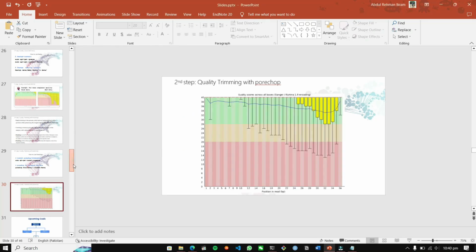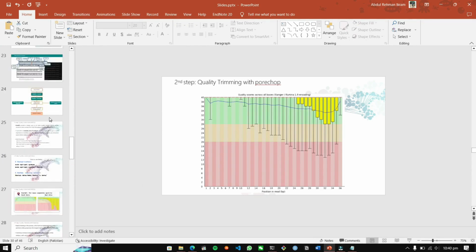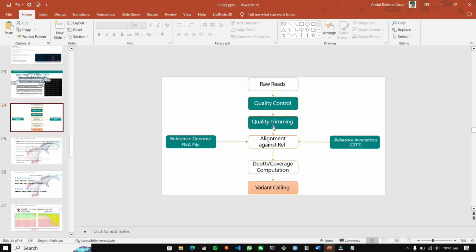So that was it for the quality trimming process. We know how to check our quality, and after checking the quality, how to trim it. Now if you are working on your main NGS data, first you have to check the quality of the data. If the quality isn't good, then apply the trimming process on it. After applying the trimming process, check the quality again. If the quality of the data has been improved, then your quality checking and quality trimming process was successful. So that was it for this lecture.